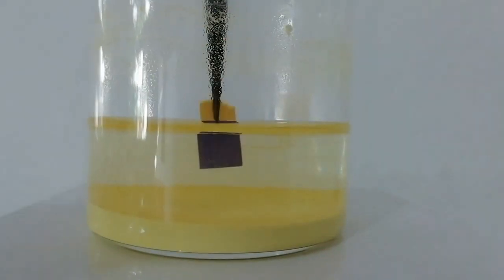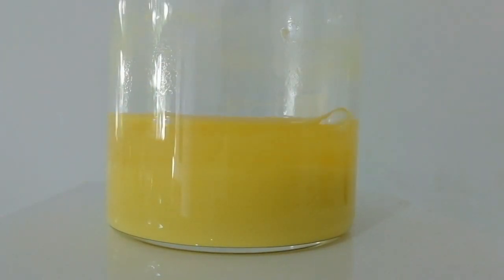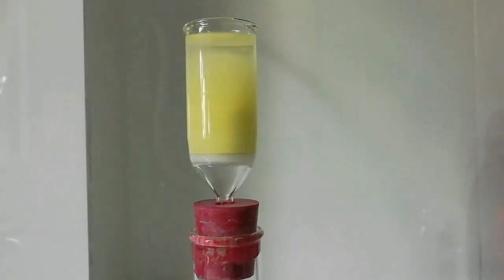Then, pH was checked and it was highly basic. The precipitate was washed twice with water and decanted. For the final step, the precipitate was filtered and the product was left to dry for storage.